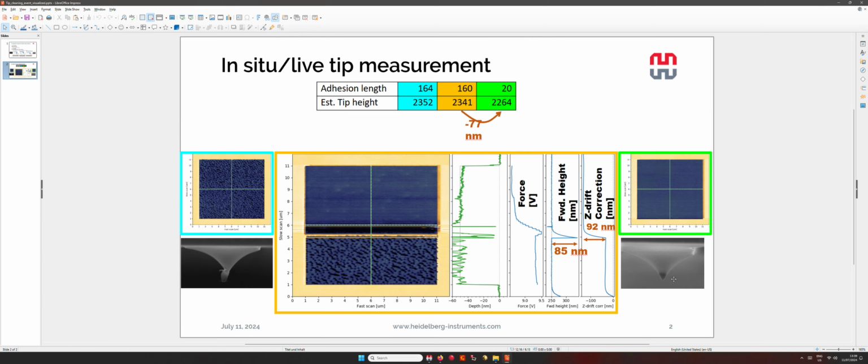After it is removed, the tip is cleaner and sharper also, and this is hopefully only silicon material. Well, here we can have some carbon contaminations, for example. So what we see is that at some point we have this cleaning event which causes an increase in the forward height. So we see this spike of forward height, but we compensate this spike by a Z drift correction. So we lower the cantilever by 92 nanometers, roughly 90 nanometers, to accommodate this increase of the forward height.